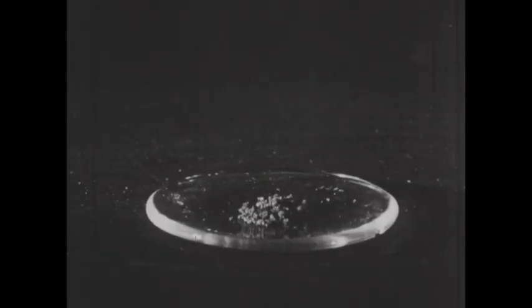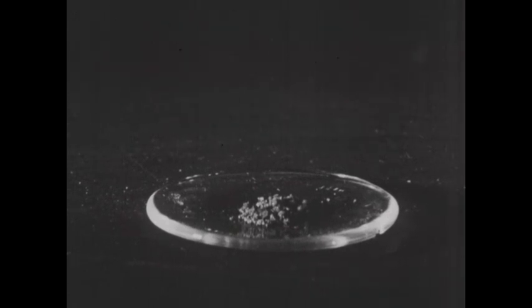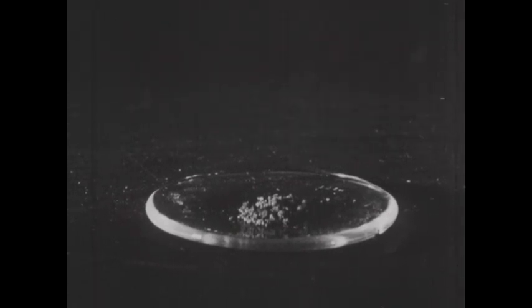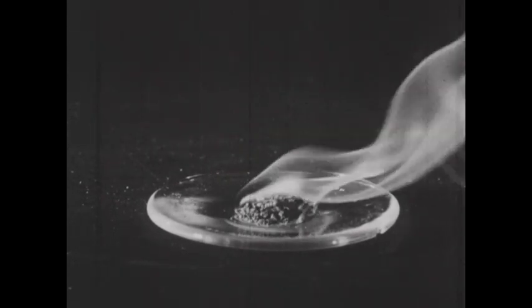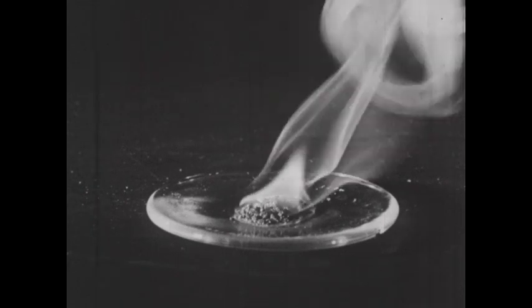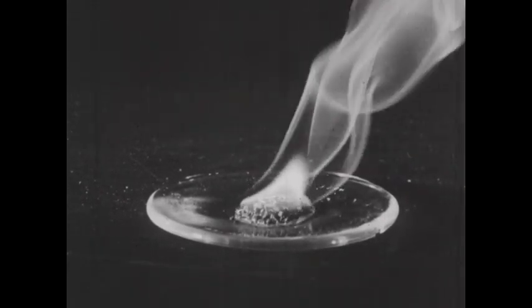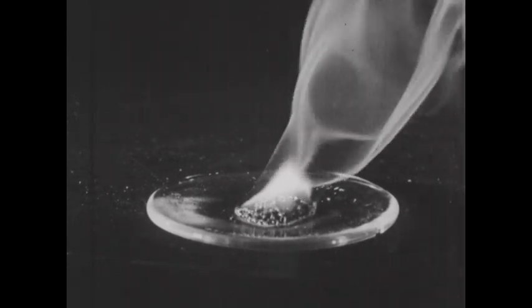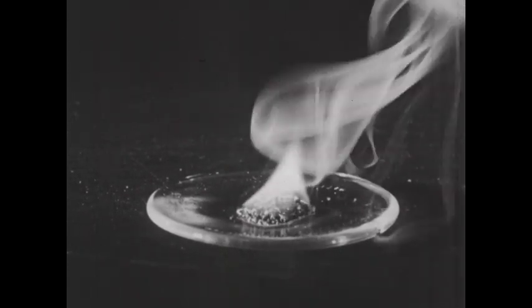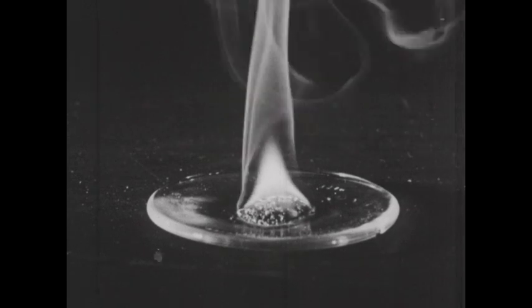Red phosphorus, like white, will burn in air if raised to a somewhat higher temperature. On the watch glass, we have a few small pieces of red phosphorus, which are lit with the flame of a Bunsen burner. You can see that the phosphorus ignites easily and burns, producing the same clouds of white smoke as observed with the white phosphorus. The product of the reaction is the same: phosphorus pentoxide.